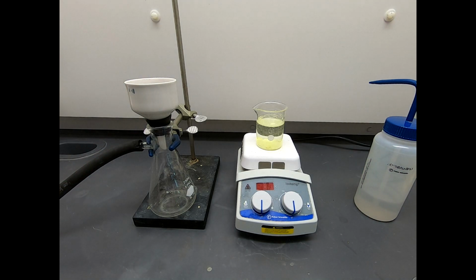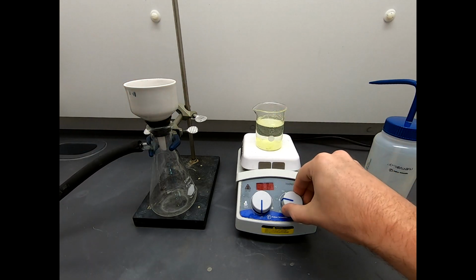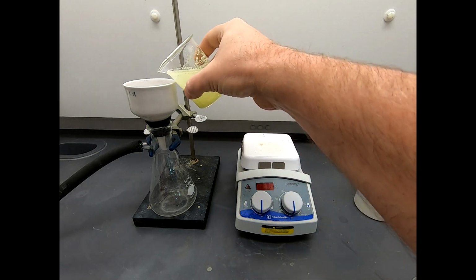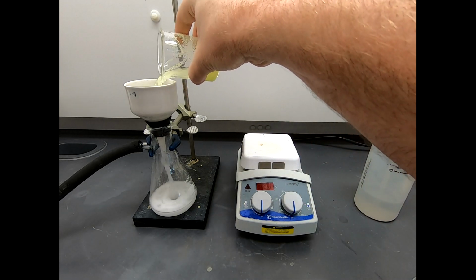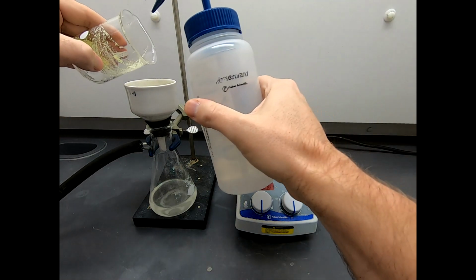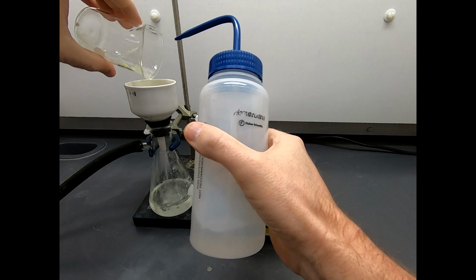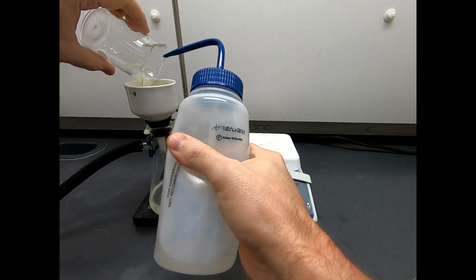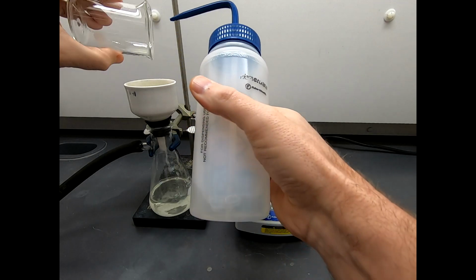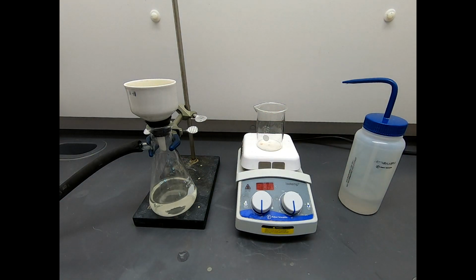So I'm going to seat the filter paper with water. Great. And that's drawing through. And now let's let that stir bar get everything nice and suspended. And then let's just filter away. And I think you can see this looks like a yellow solid. Let's see, impure crude material is yellow. Okay, not perfect, but I think good enough. That's a pretty good transfer. So this is now our filtered product.